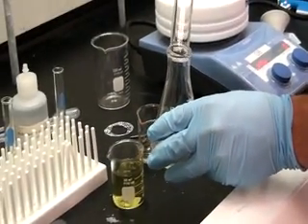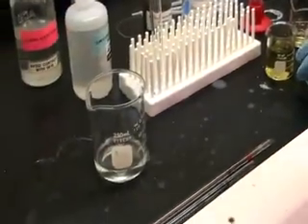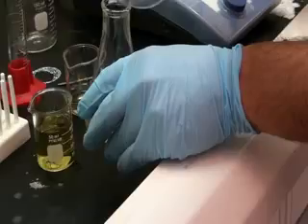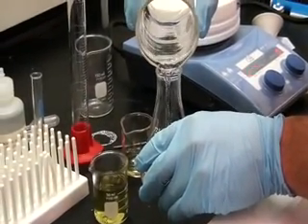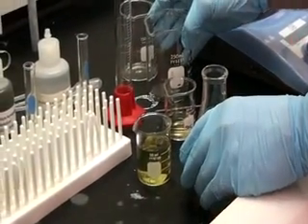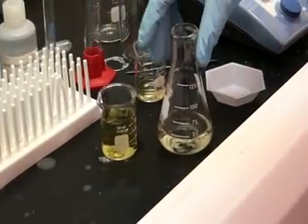We will also add 32 ml deionized water. We will now proceed into a dark room to mix our solution B into the flask and view the light producing reaction.